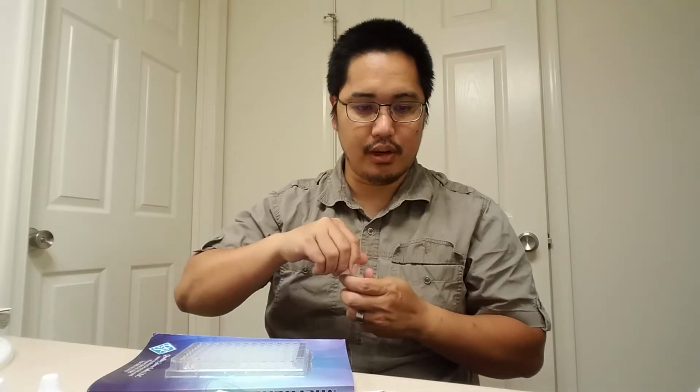So what we have is 0.1 moles, and then we divided that by 5, so now we have 0.02 moles, and we divided that by 5, and so we have now 0.004 moles, and so on and so on. Now I'm going to put 1 drop of the sodium oxalate inside of wells A1 through A7. So I have the most concentrated version of calcium nitrate in A1, and I'm going to put 1 drop in each of the wells A1 through A7. So I'm kind of putting 1 drop to a less and less concentrated version of calcium nitrate.